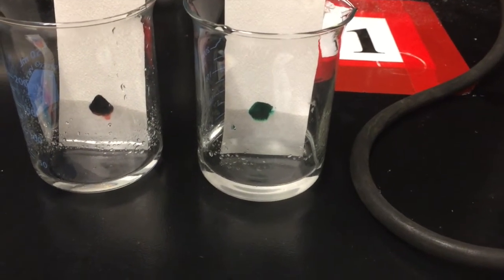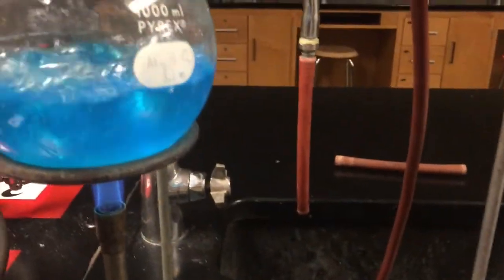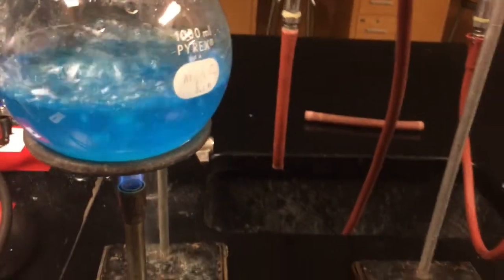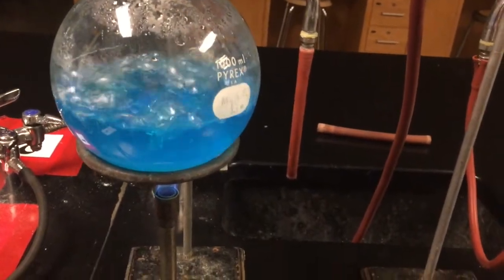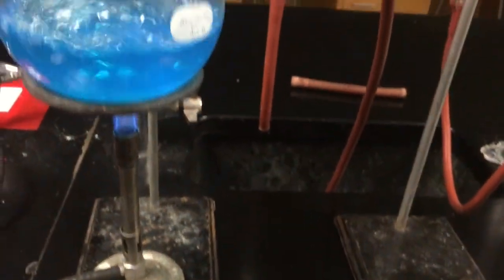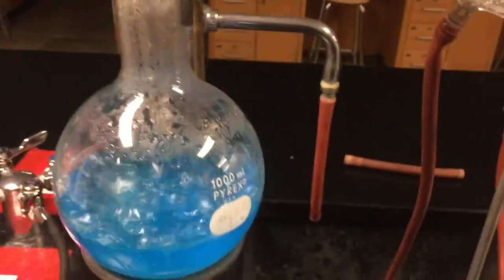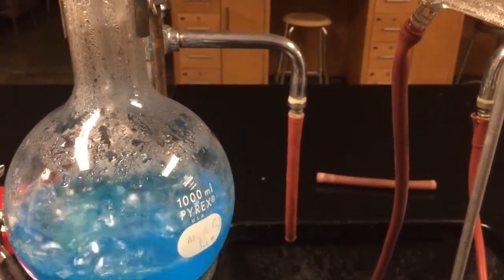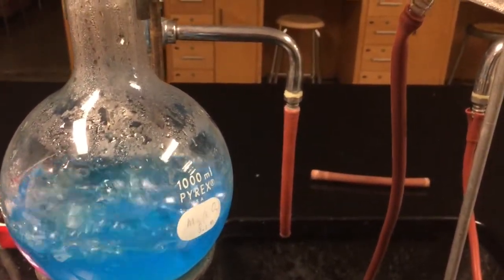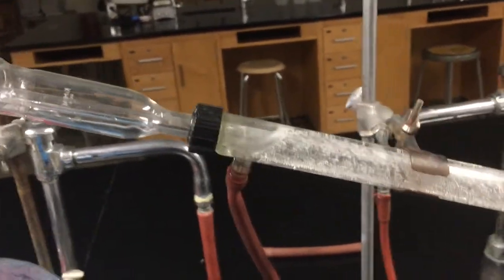Inside my boiling flask here, I have some copper sulfate solution. You can see it's not pure water. It's a homogeneous mixture. And I'm boiling it. And as I boil it, the water in that solution ends up boiling. And the copper sulfate doesn't boil. It stays behind. So the steam rises and it goes through this condensing tube.